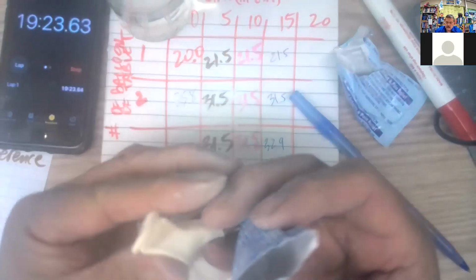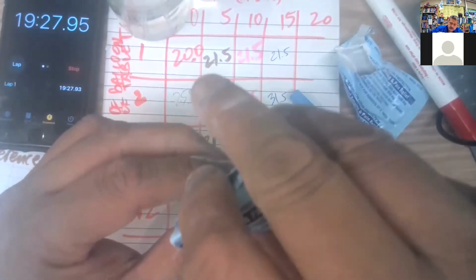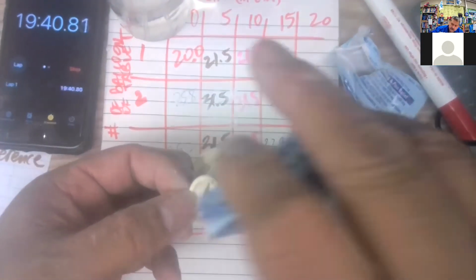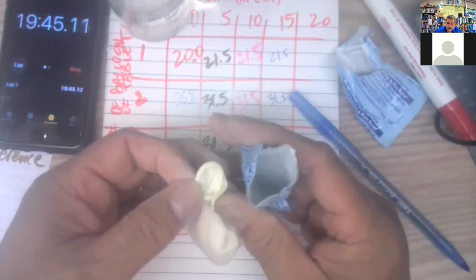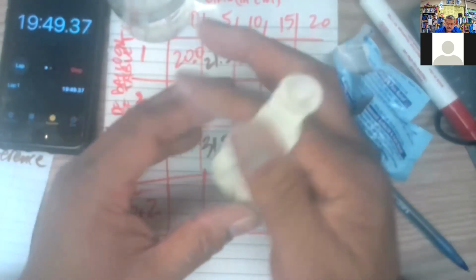There's some more. And I watch the clock because I'm probably just going to pour this in here and add the water after we do our last measurements. Looking in there, looks pretty good, right? A little teeny bit there at the bottom. Good. All right. So this is our last one.